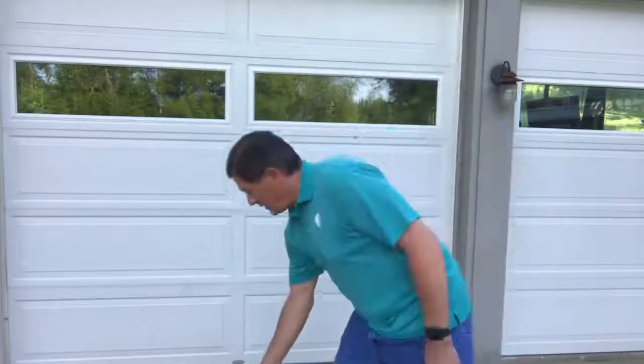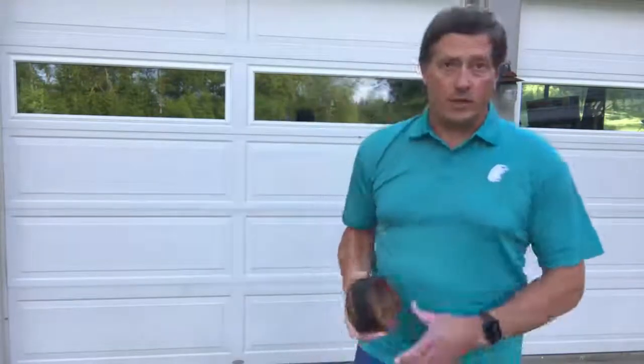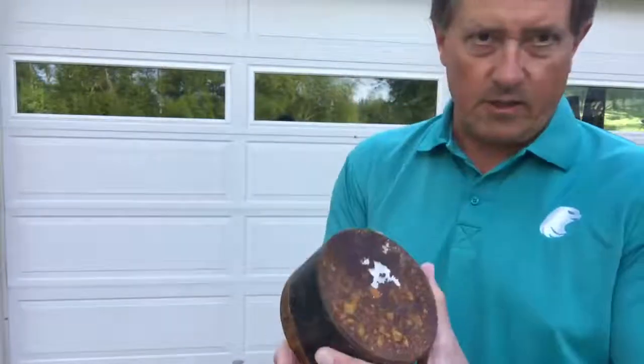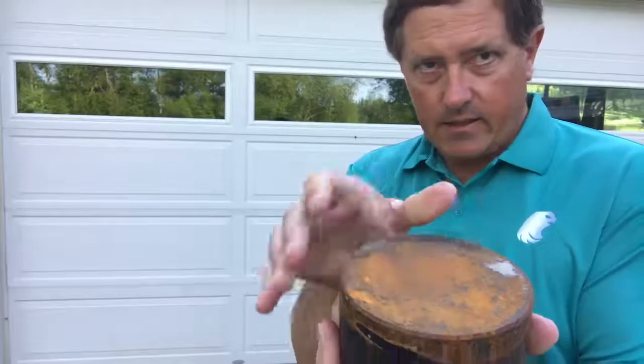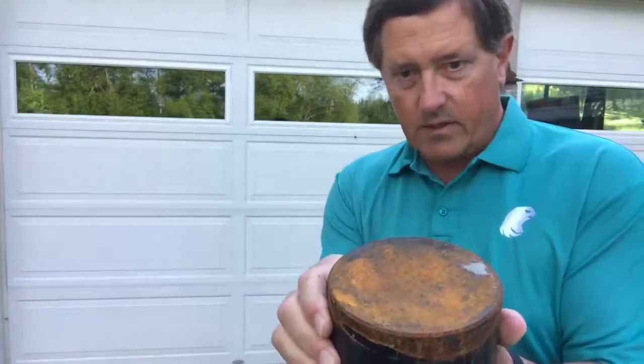The indenter is going down into the metal, and anything that's in between the metal and the indenter is going to affect the reading. So I took an old used up test block, and don't use your test block like this, but I left it outside. So it's got a little rusty. I can't test on this because I'd be testing the rust.